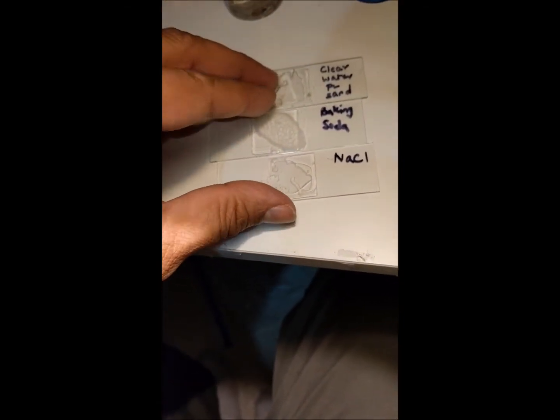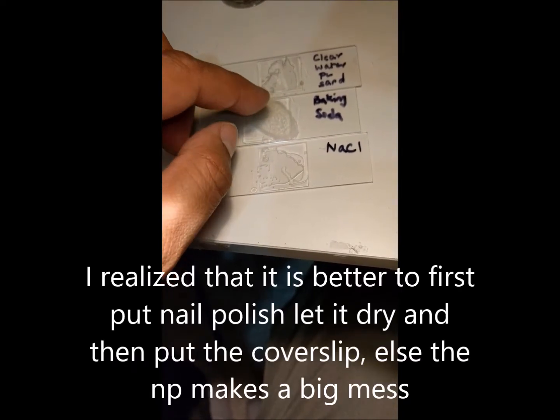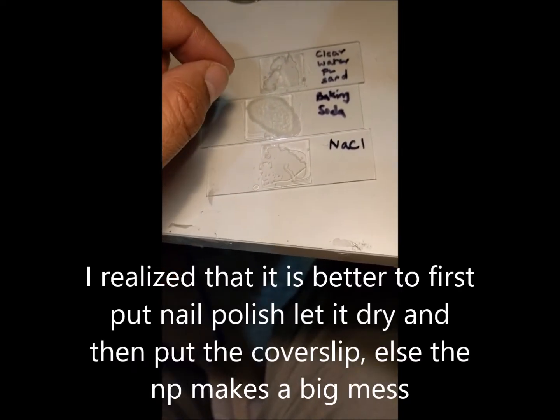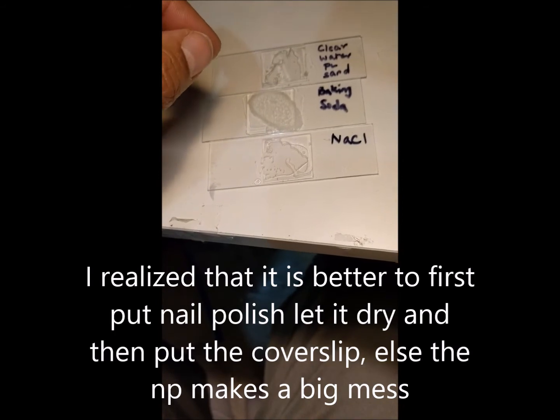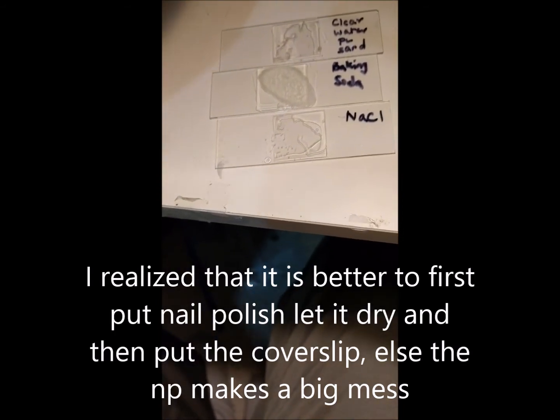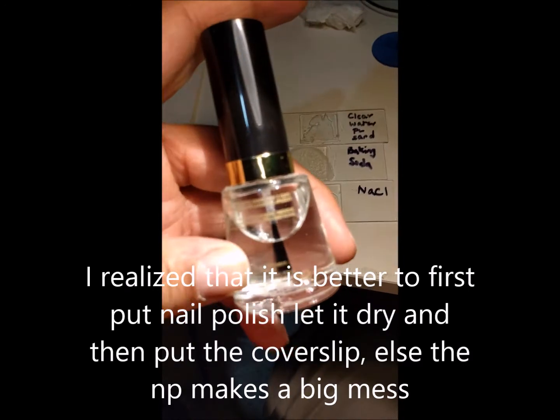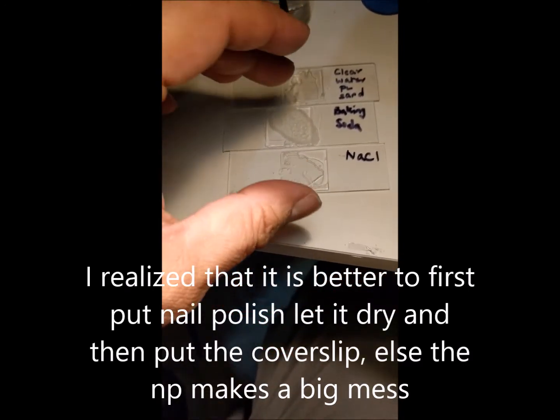Since I wanted to preserve these slides, I allowed the baking soda to form crystals by dissolving it to saturation and putting some on the slide. Then I used some clear nail polish and put a cover slip over them, so you can make a permanent slide very easily this way.